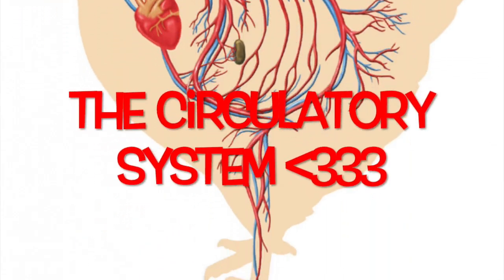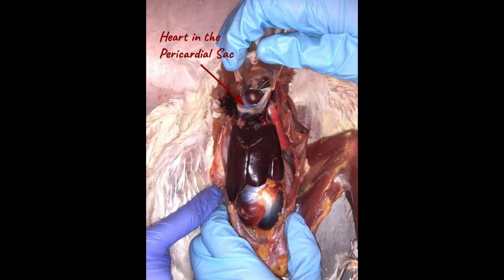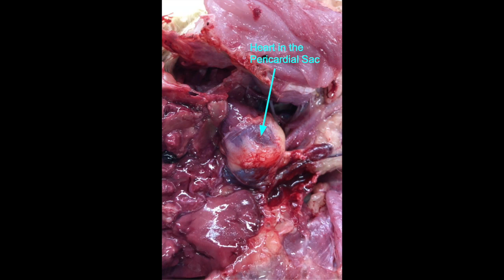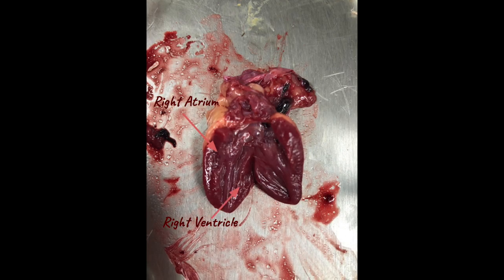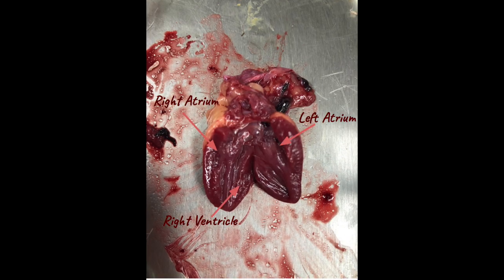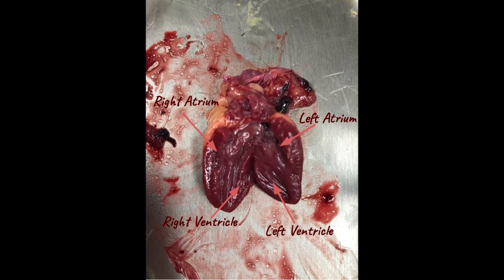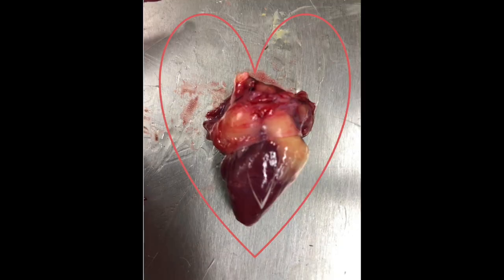Helena has a four-chambered heart surrounded by the pericardial sac. You can see the right atrium, the right ventricle, the left atrium, the left ventricle, and the aorta. Some people say the heart is the organ of love, but Helena's heart is ice cold.